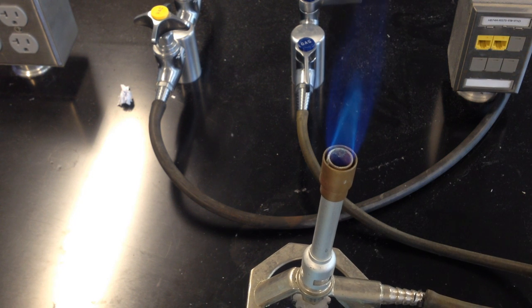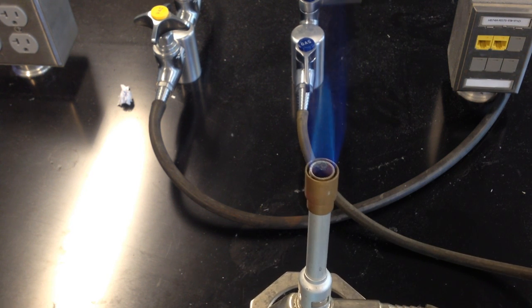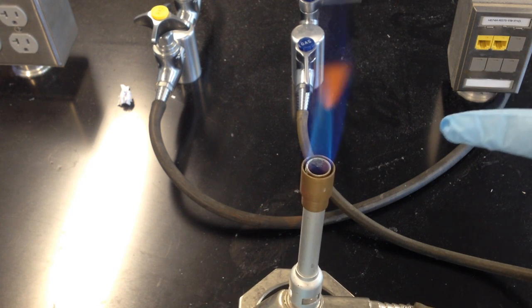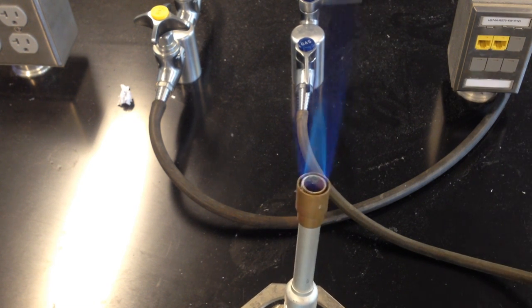You'll notice that the cone has now gotten tighter now that I've opened the oxygen a little bit. So this is about where you want it. This is perfect. The hottest part of the flame is right there at that inner cone, and it's blue along the outside.